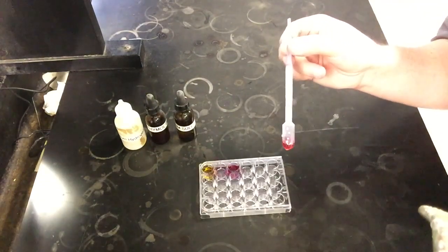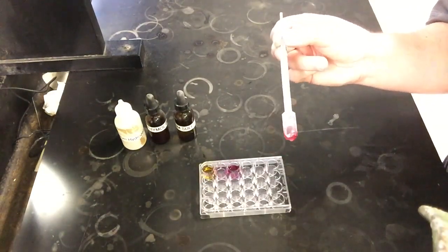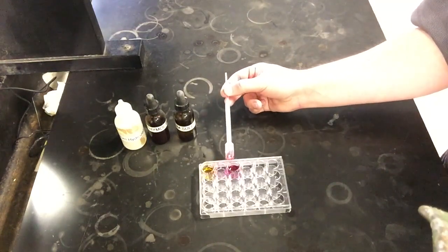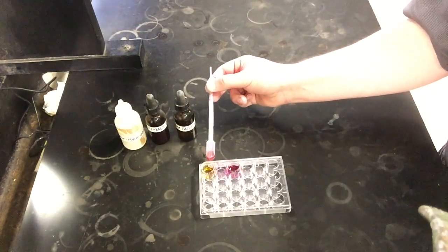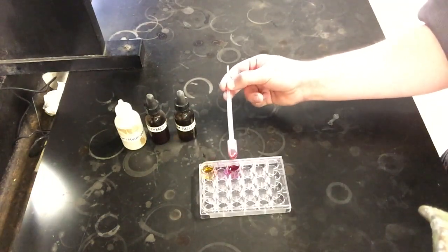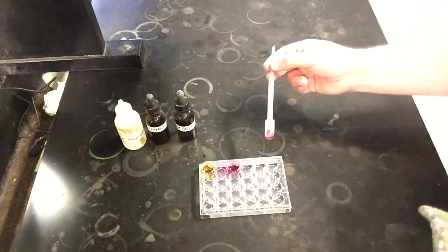All right, so here we are a couple minutes after heating. It looks like it's a little bit red in color, but at the very least, in comparison to where it started out, it looks like it has lightened some. So it's maybe not quite as fully yellow as what we saw before, but it's also not as dark, deep purple as what we started out with.